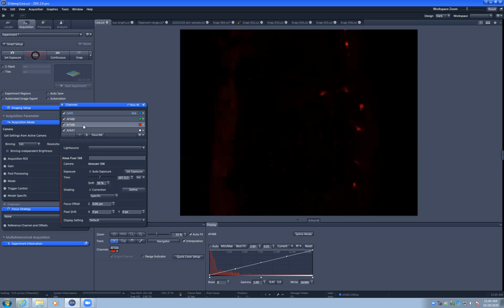So for instance, if I'm looking at the red channel, I'm currently live. At every moment that I'm speaking to you, this sample is being exposed to light. If it were a live sample, this could be damaging the biology. And it also, for this fixed sample, is likely bleaching the red.